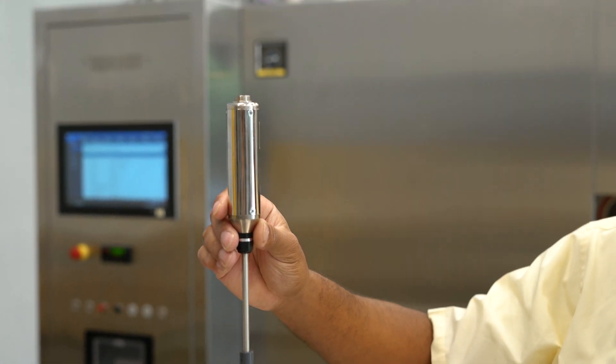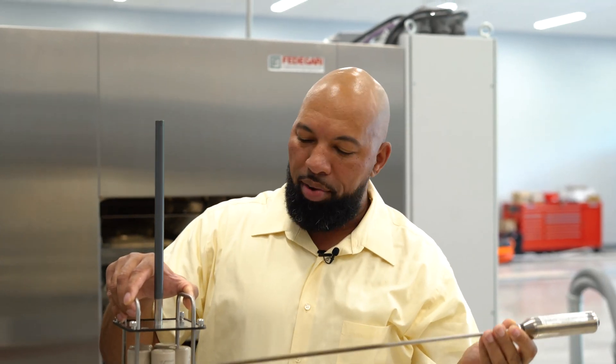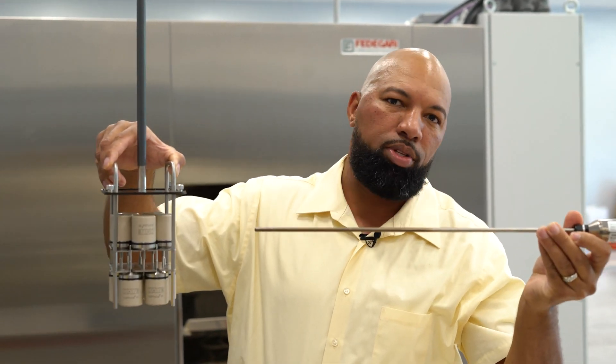As you can see, we have here an IRTD. This is our temperature standard that's used to verify the actual probes. Everything here inside the basket will be verified against the NIST traceable standard.